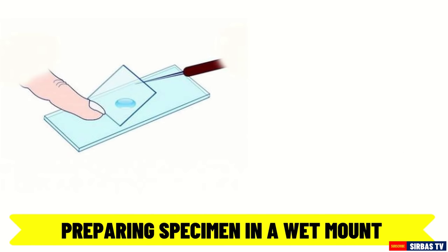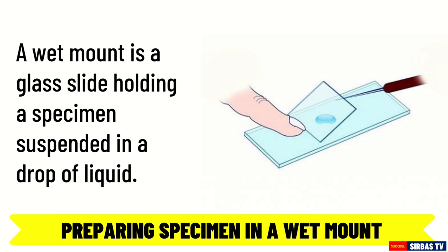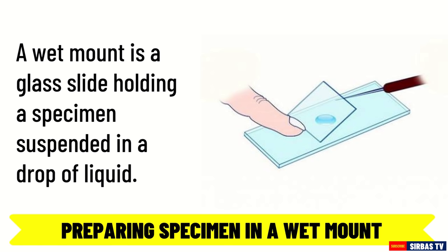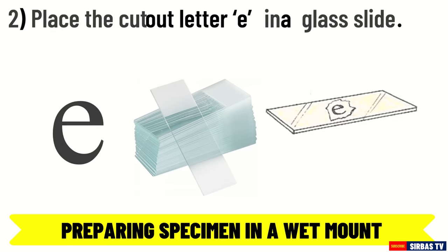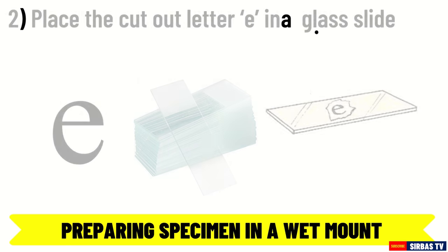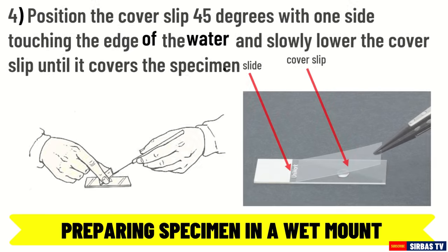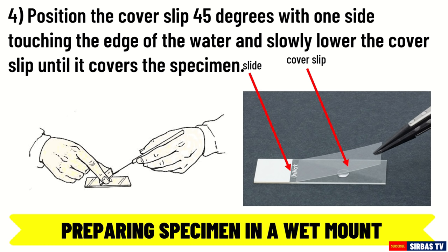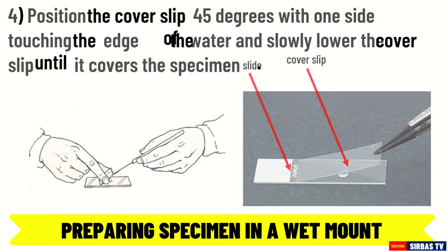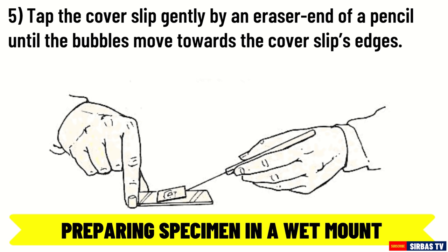Here are the steps for preparing the specimen in a wet mount. A wet mount is a glass slide holding a specimen suspended in a drop of liquid such as water for microscopic examination. Step 1: Cut out the letter E from a newspaper clipping. Step 2: Place the cut-out letter E on a glass slide. Step 3: Add a drop of water using a dropper or cotton ball. Step 4: Position the coverslip at 45 degrees with one side touching the edge of the water and slowly lower it until it covers the specimen. Step 5: Tap the coverslip gently with the eraser end of a pencil until the bubbles move toward the coverslip edges.